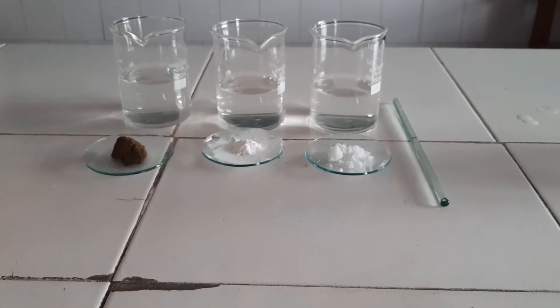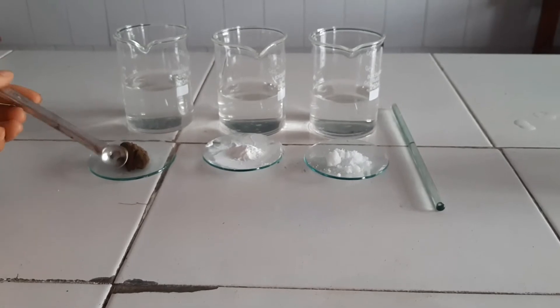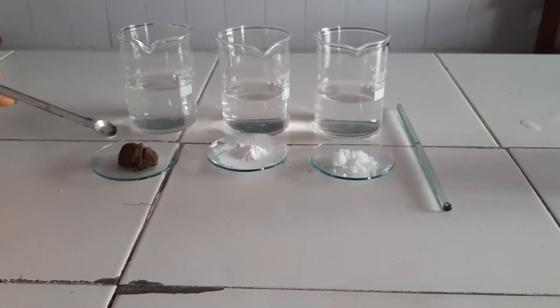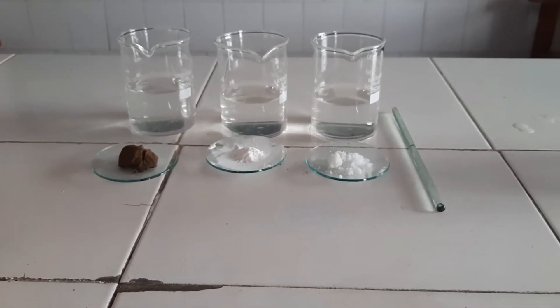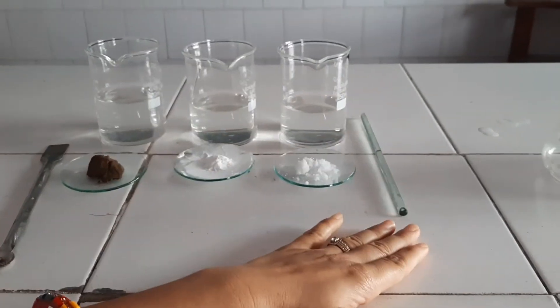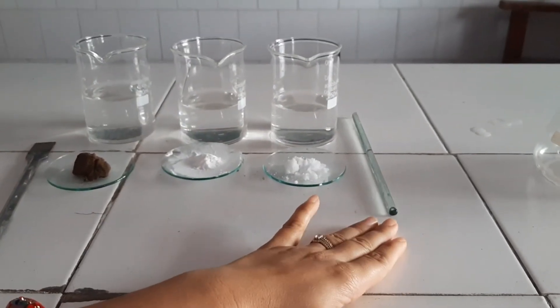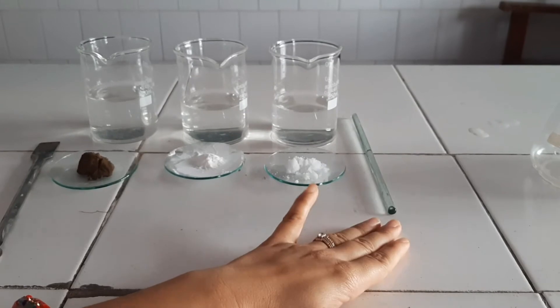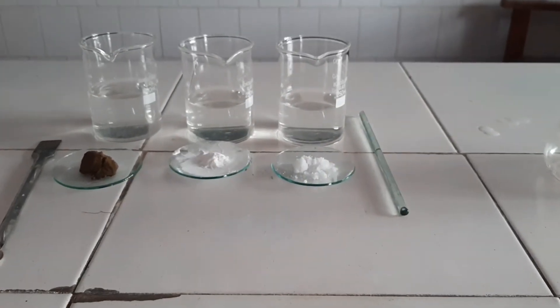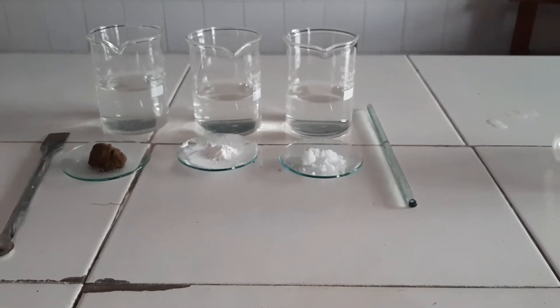Two other things are also visible: this one is a spatula, which is used to take chemicals or substances in a particular amount and add the sample to water. And on the other side, this is the glass rod which is used to stir the solution and dissolve the substance in the solvent.